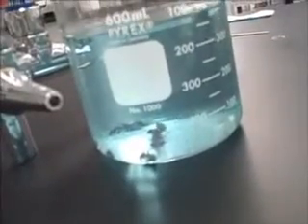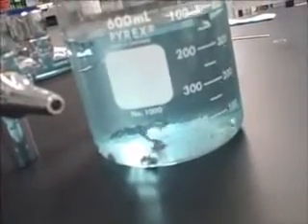We'll decant off and pour the rest out. And you can see that those are copper colored.